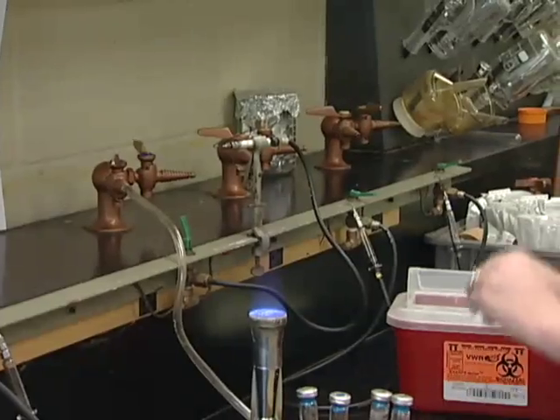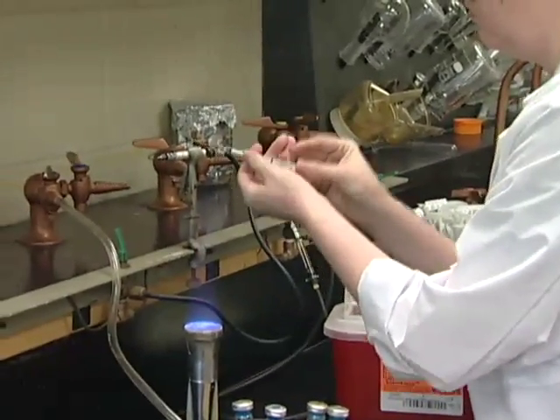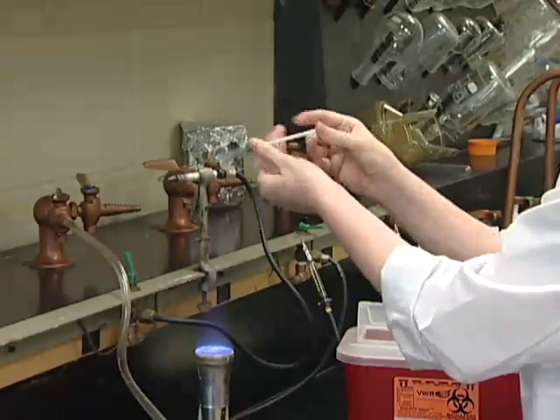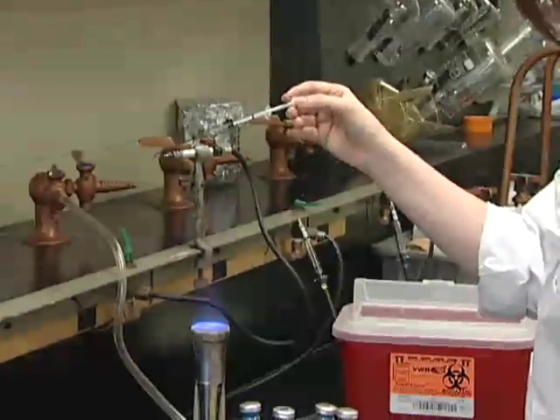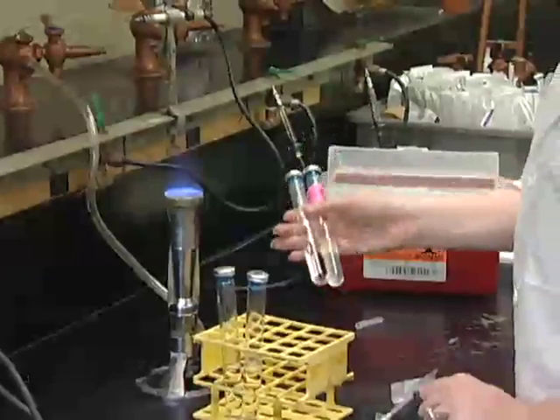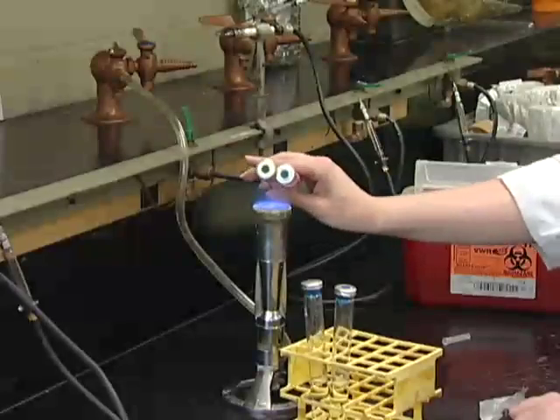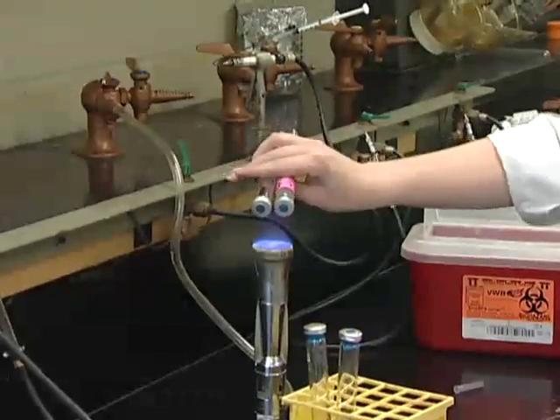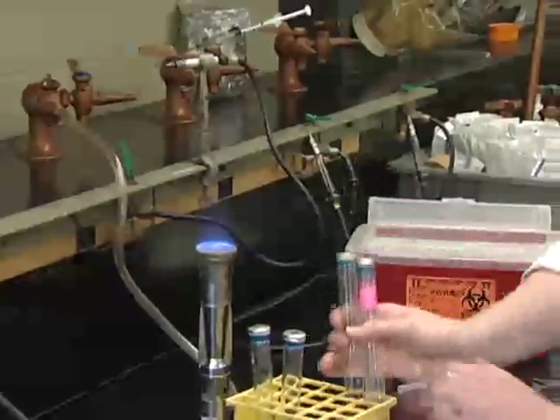Now you'll get out your syringe and flush it out 5 or 6 times. And you'll hold this in, or in some cases you can just let it sit, like I'm going to do right now. And you'll take both of your tubes and flame them. You want to make sure that you're doing this kind of at an angle, because if you hold them upright like this, you're going to burn your culture. Okay?